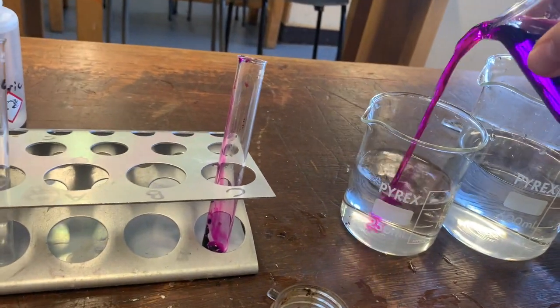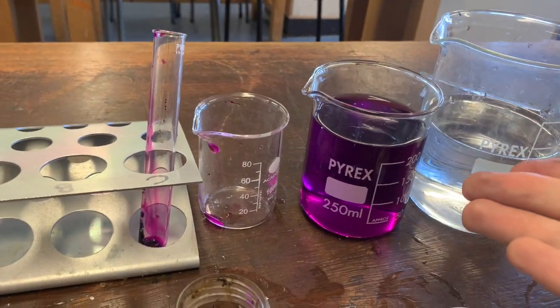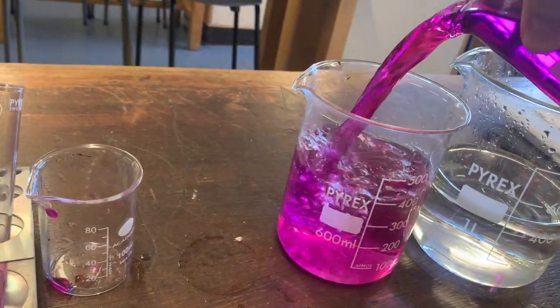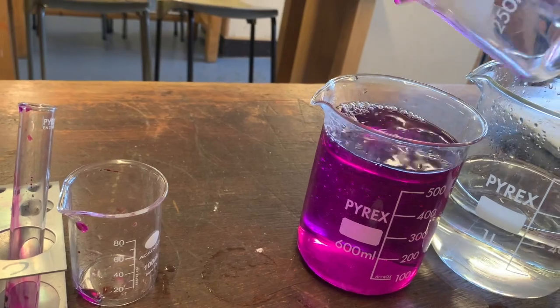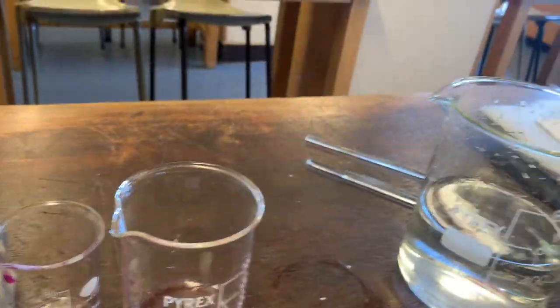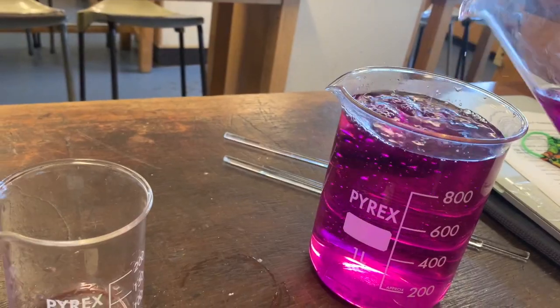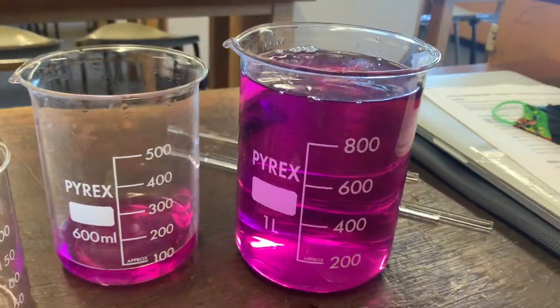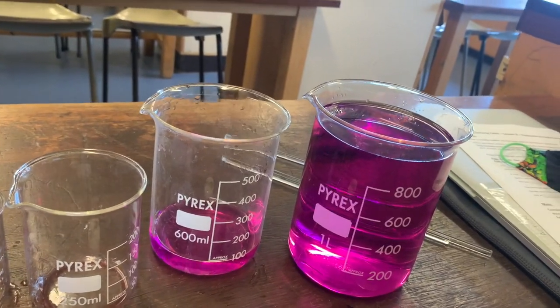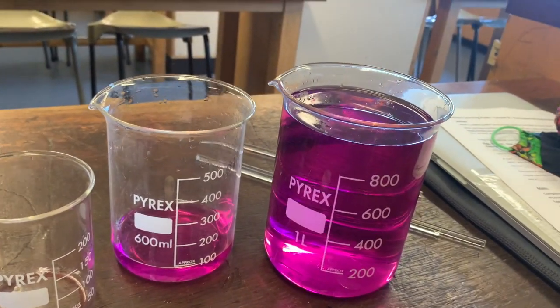If I take this and pour it into even more water, you can see that the colour becomes less purple. If I take this and pour it into even more water, the colour becomes less again. And if I take that and pour it into even more water, we get a much lighter colour. So the colour got lighter, even though I had the same number of particles, because it was dissolved in an increasing amount of water.